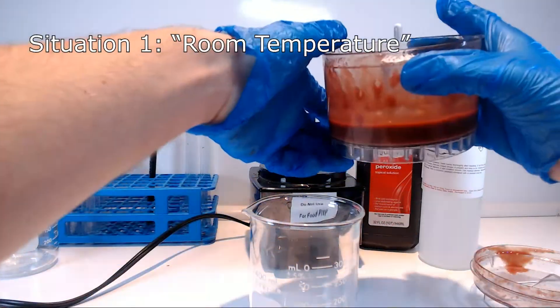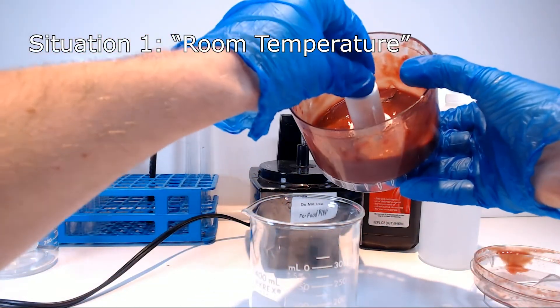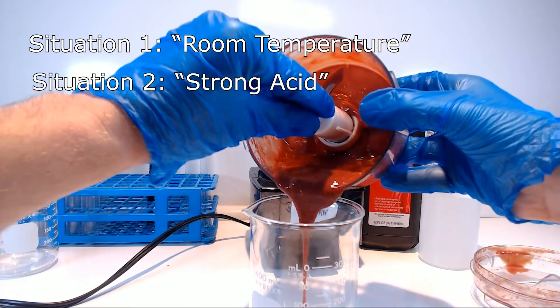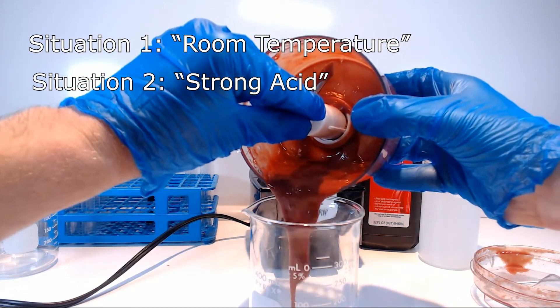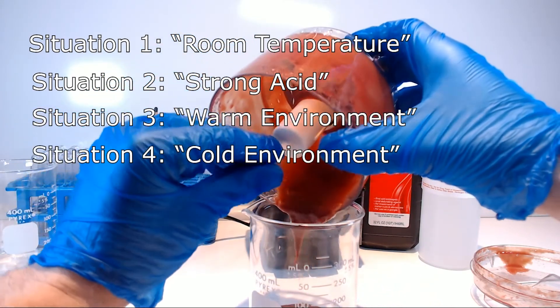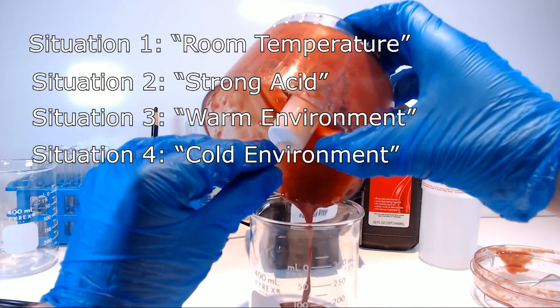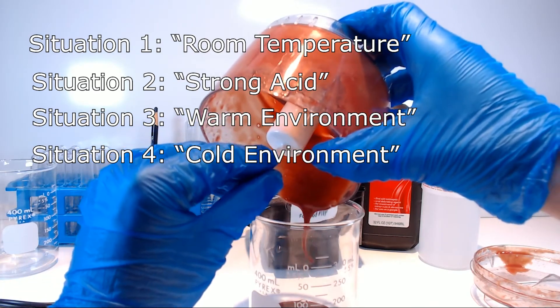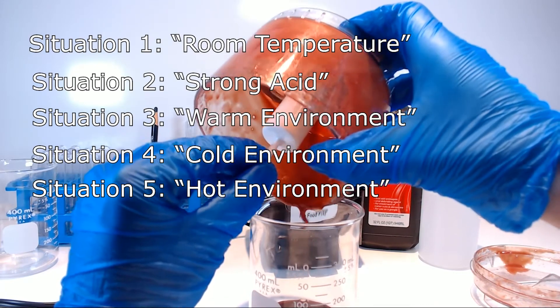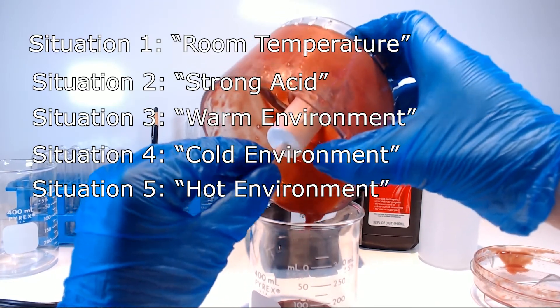We're going to be looking at a reaction at room temperature, at a low pH, at a warm temperature, under an ice bath, and we're going to be looking to see what happens to this enzyme after it's been boiled. So I hope you have your lab protocol in front of you. Let's begin the experimental procedure.